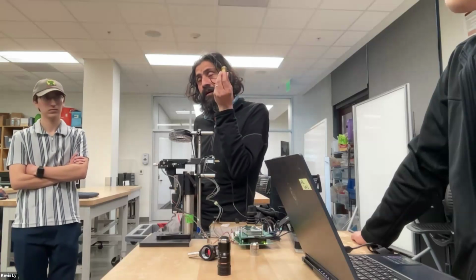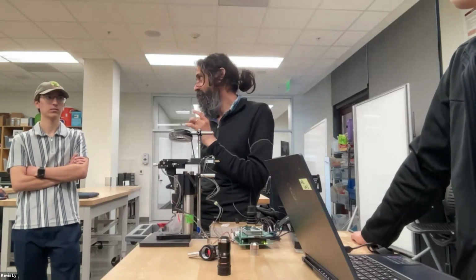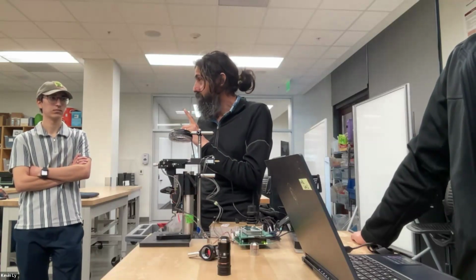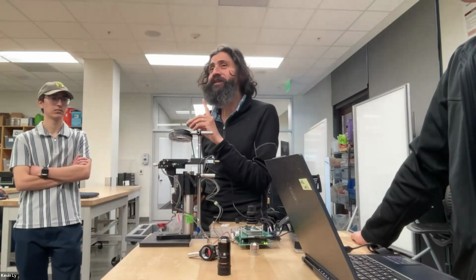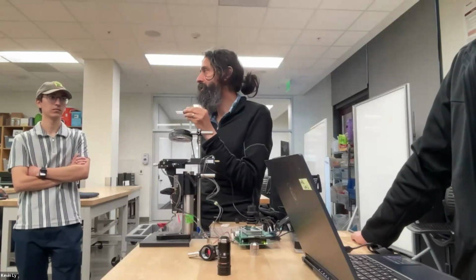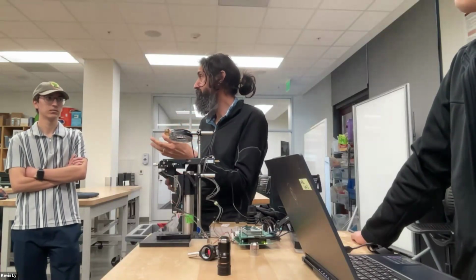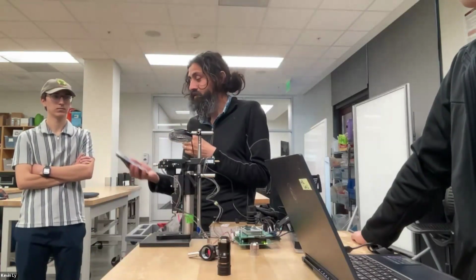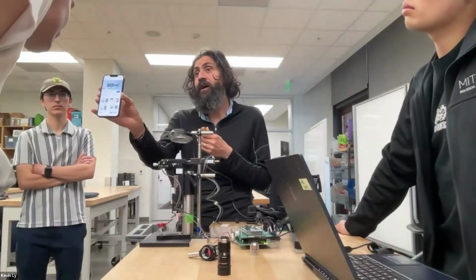This is called a compound lens, compound being many of them joined together. Leeuwenhoek made a simple lens with only one single lens. But actually, compound lens microscopes were invented first. Simple lenses came later because of this aberration issue. With one single lens, it's very difficult to correct the aberration, because mathematically you need more degrees of freedom. Every correction we discussed requires more surfaces to bend light. So now this is an example of what an objective would look like if we were to cut it.